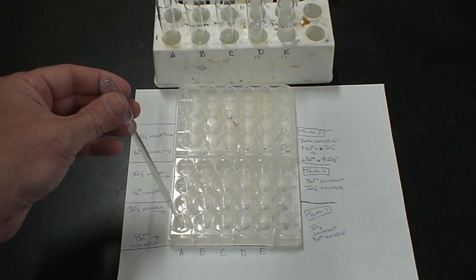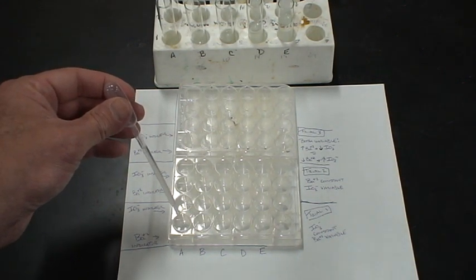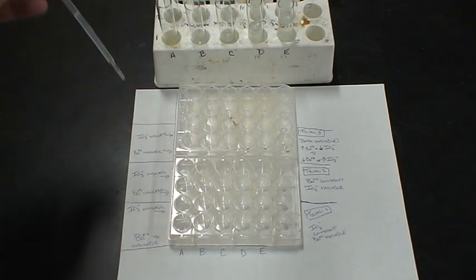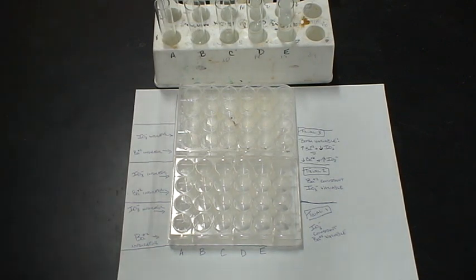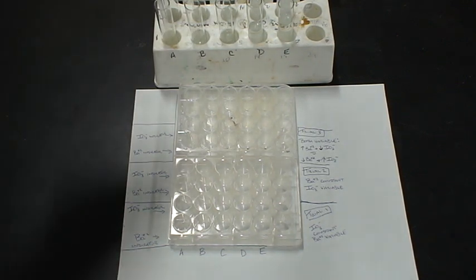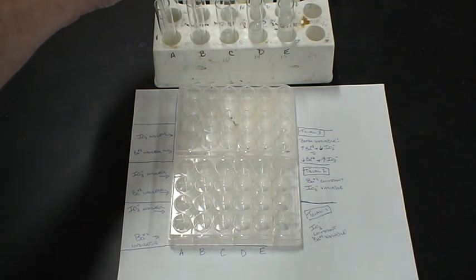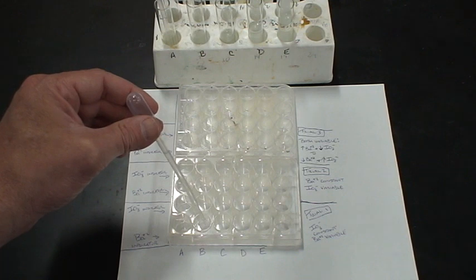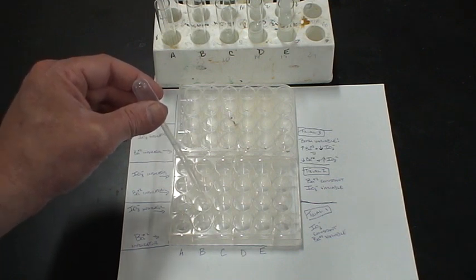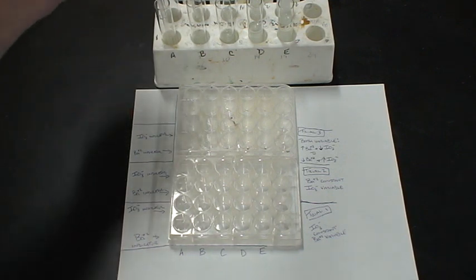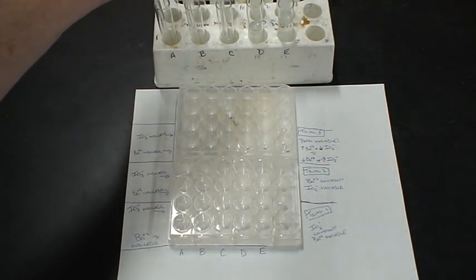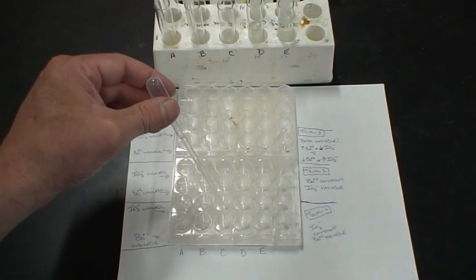We're going to add three drops into well A, three drops into well B, one, two, three, one, two, three. And to well C, one, two, three, one, two, three.